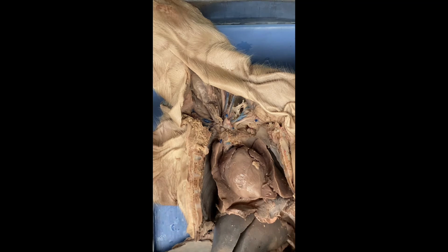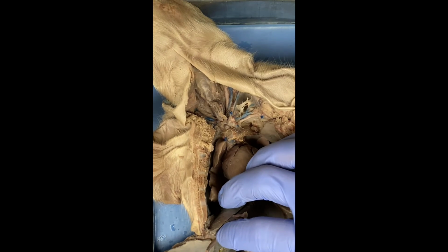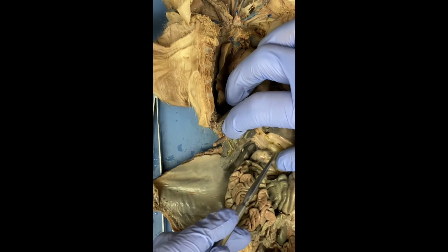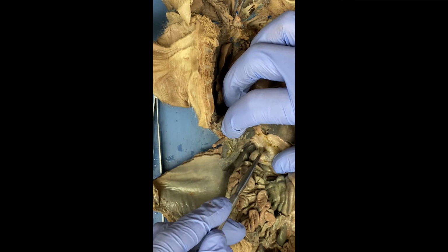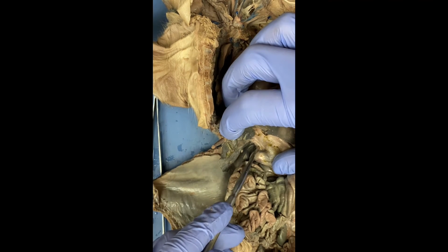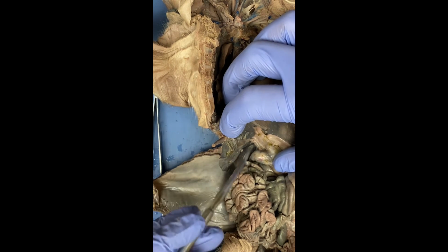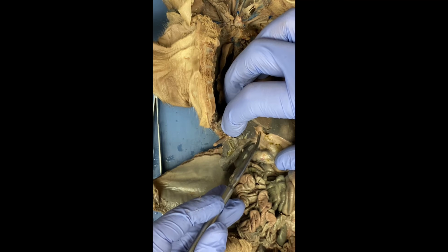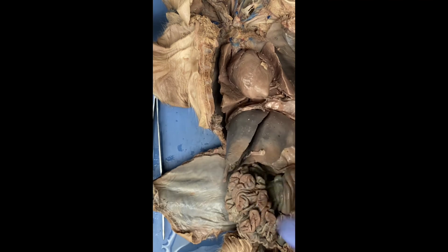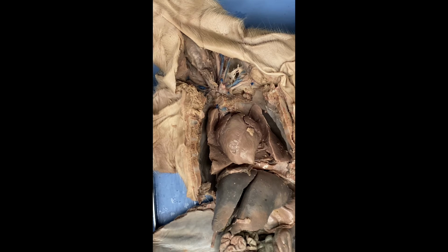Lastly, we have the gastric artery, which is the stomach, which is going to be, let me scooch the animal up. Oop, oop. So this is the stomach right here, and the gastric arteries are going to be here, and they are providing blood flow to the stomach. And then the hepatic artery, which means the liver, is going to be right here. You can see a little bit of red, and that is bringing blood to the liver. And so that's going to do it for the circulatory system of this animal.